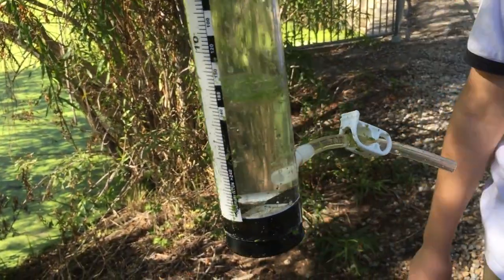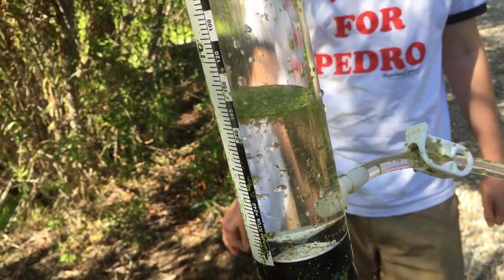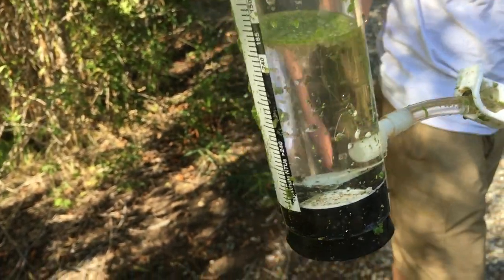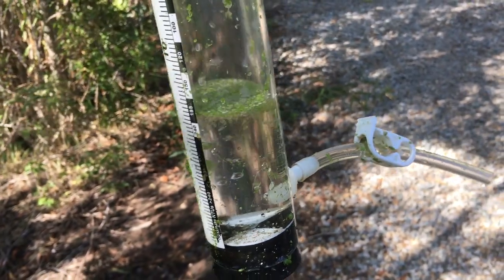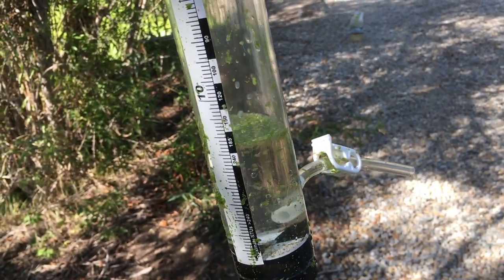That number would be a lot lower if there wasn't duckweed. So we have an error in that the duckweed at the top is obscuring the Secchi disc. There is the Secchi disc at the bottom, but we have some obscurity. This is an error, but I did want to show you how to use the Secchi disc.